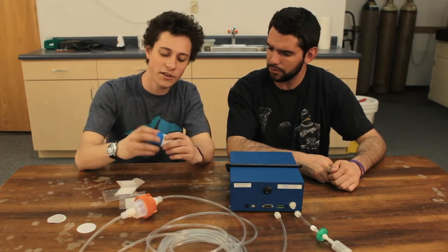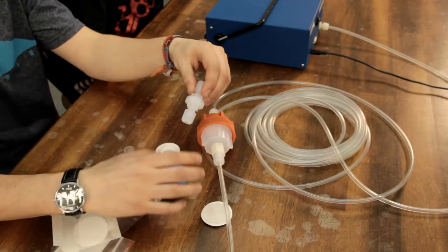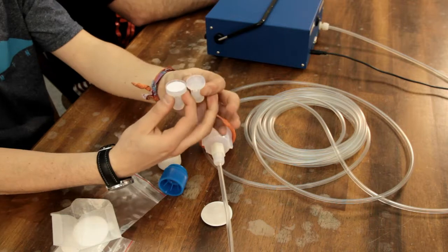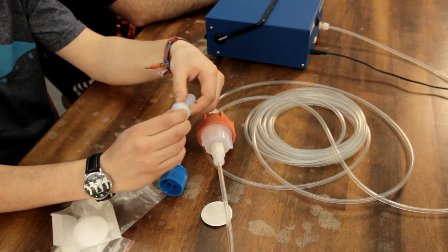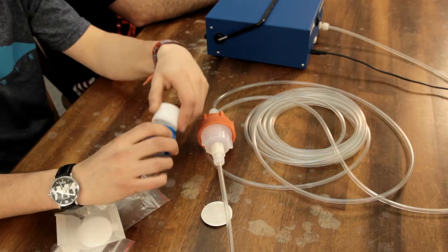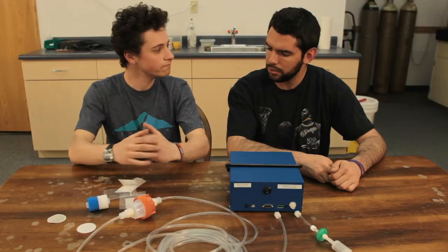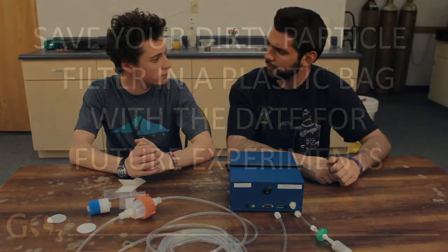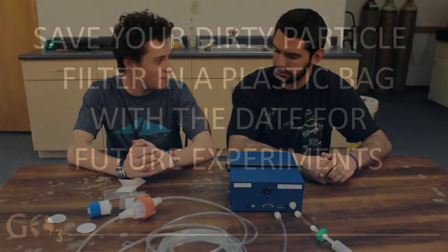Also, if you're using this housing, unscrew and pull apart the teeth. Then do the same thing, change your particle filters, realign the teeth, and twist it right back on. Cool. Now, with the dirty particle filters, I can just throw those away, right? No, you're going to want to keep them and put them in a dated bag.